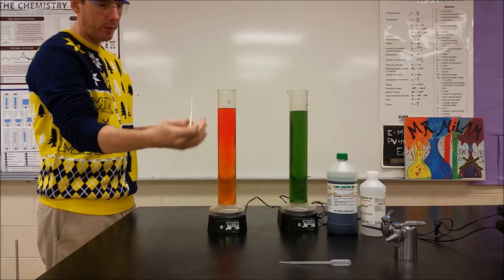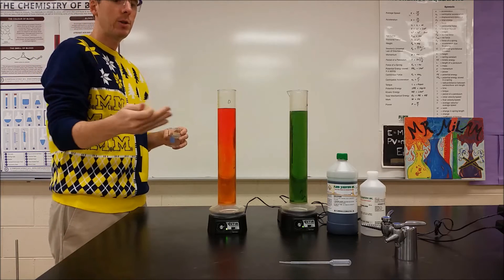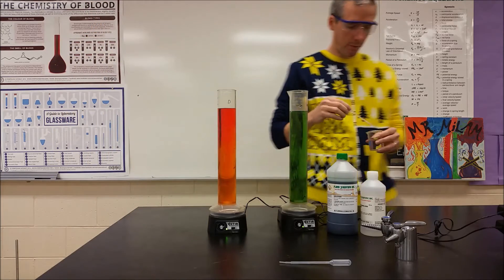Whereas in the distilled water, now we're definitely into an orange color. We're kind of right at the top. And so we're changing pH units a milliliter at a time here. And yet, for some reason, this one is lingering a little bit more.